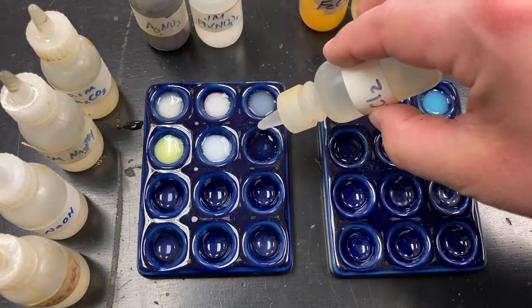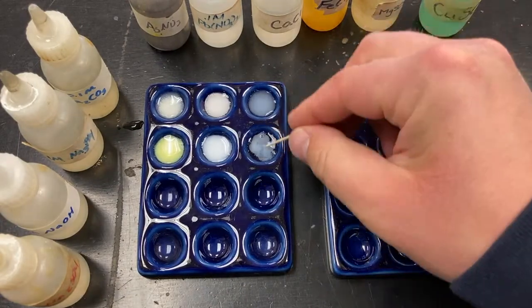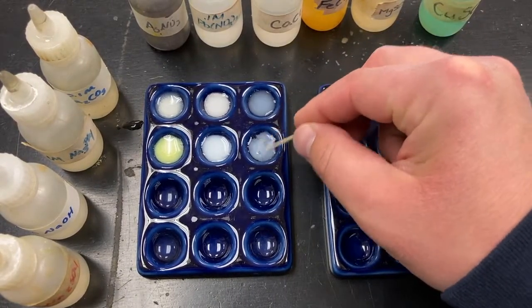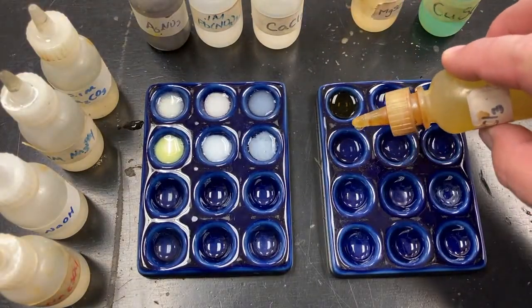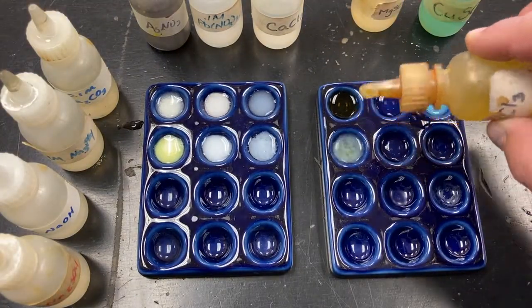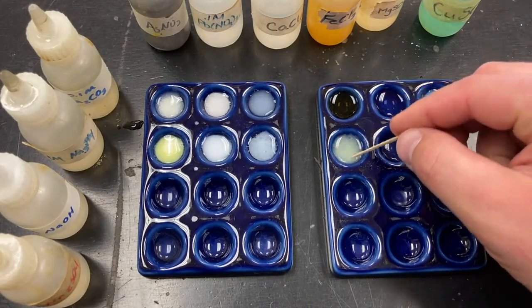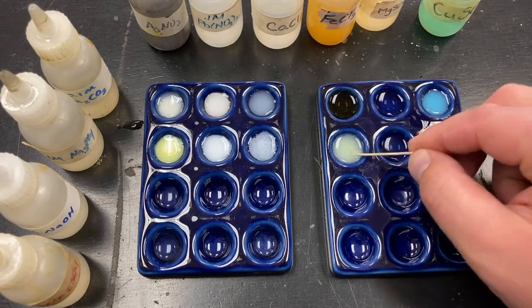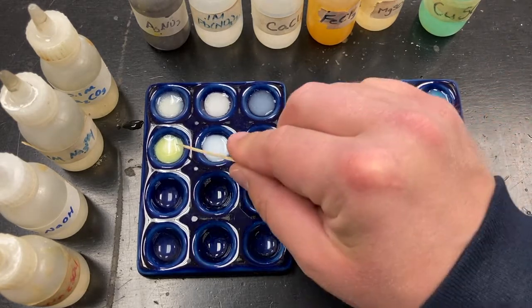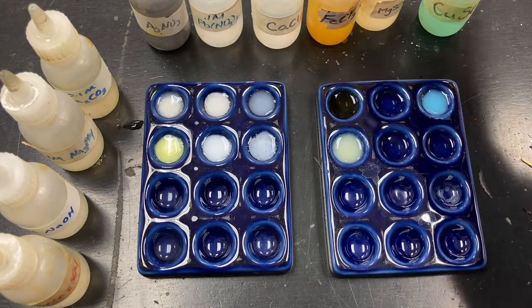Calcium chloride. That also forms a white solid. Kind of chunky, a chunky white solid. Iron chloride. Now, I am colorblind, so I'm not exactly sure what that is, but you might have to identify that one yourself, to be honest with you. I don't know the color of that. It's not white. It's also not yellow, or pure yellow. So we'll zoom in on that a little later.